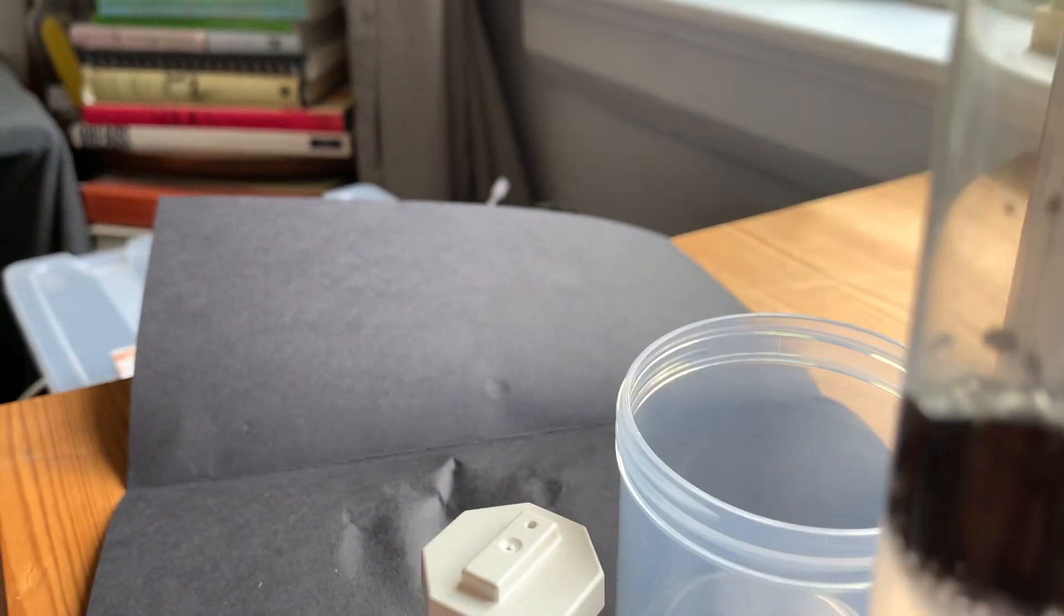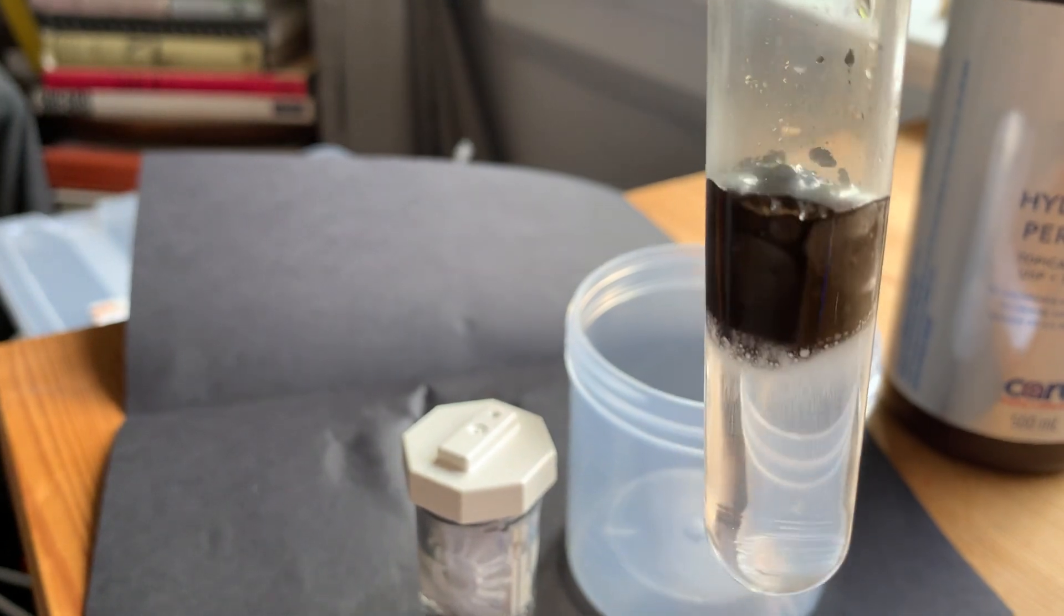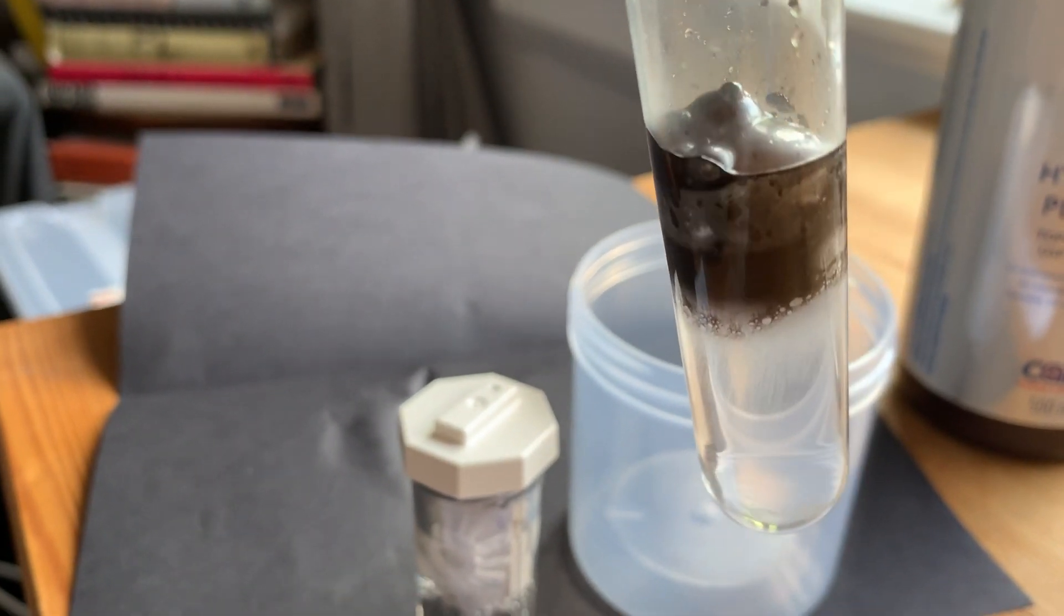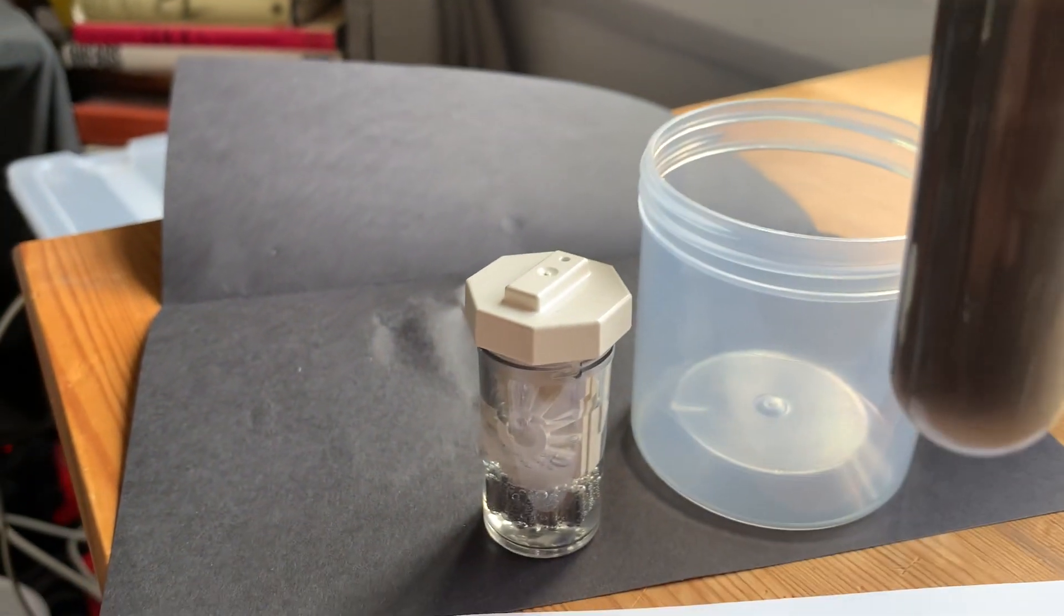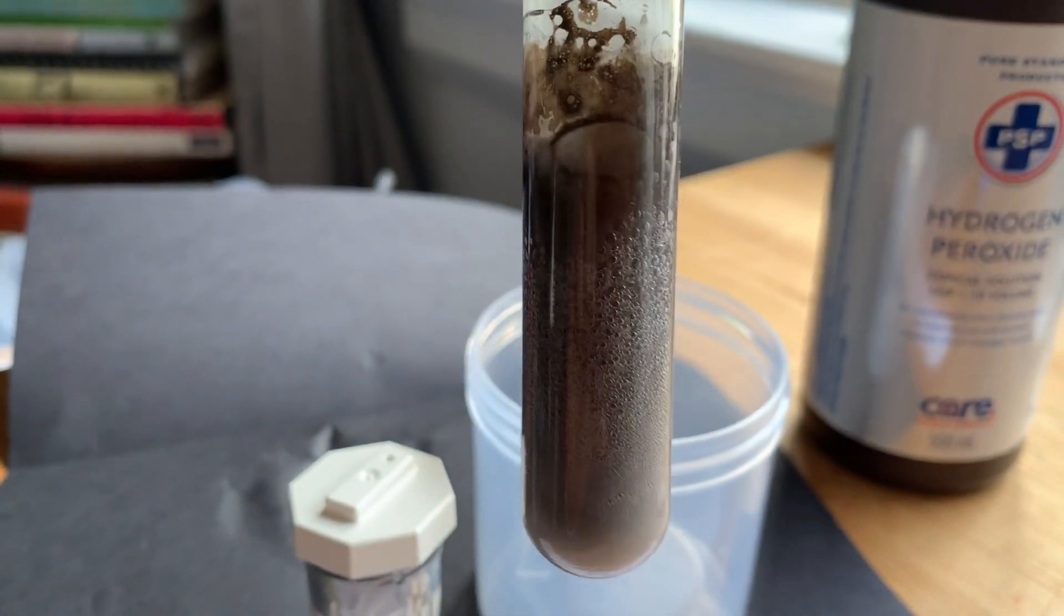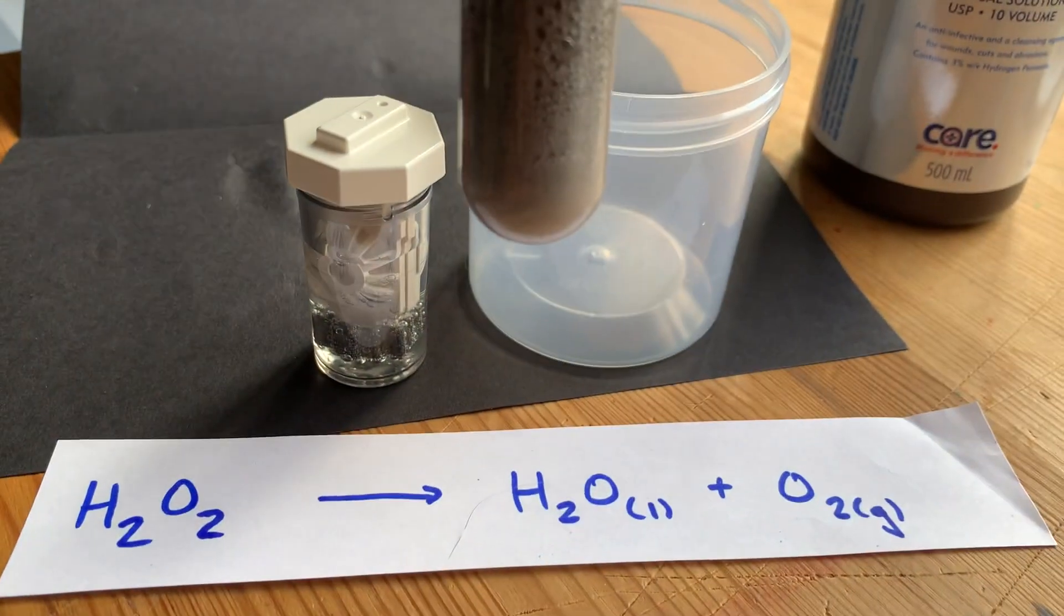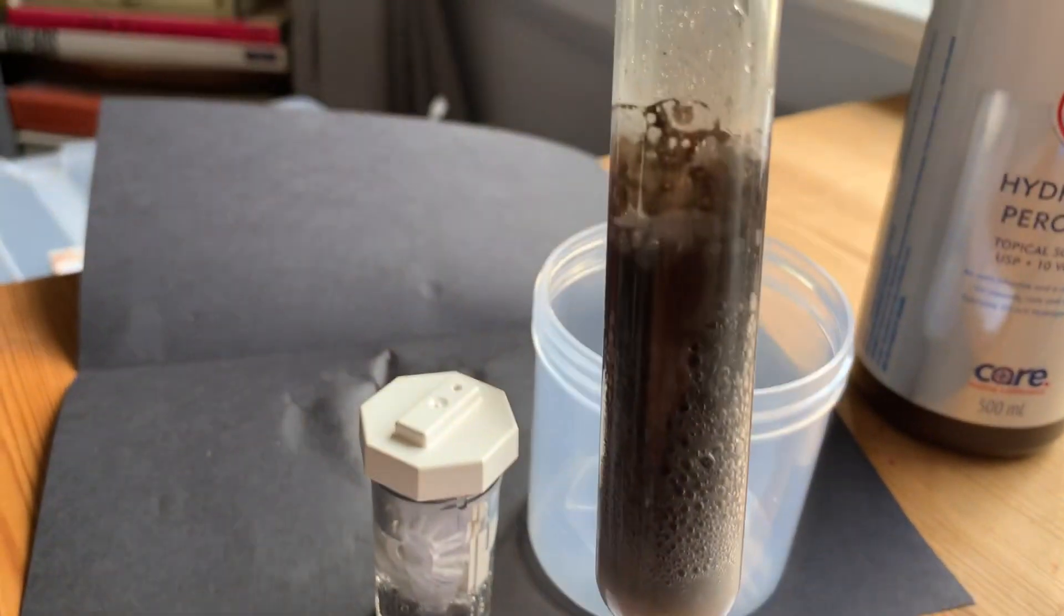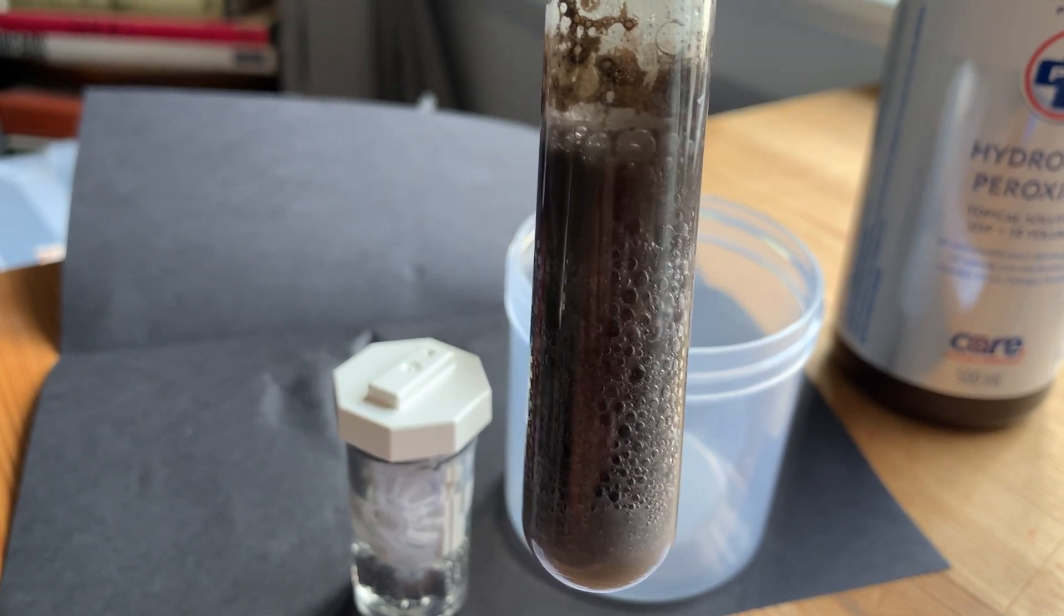Oh yeah, look at that. You can see and hear it bubbling. I know it's a powder, so it's kind of floating on top. Let me just shake that up. I've got little tiny bubbles forming in there. Looks like a dangerous reaction, but I do assure you it's just liquid water and oxygen gas that's forming in there. You can definitely see the bubbles forming there.